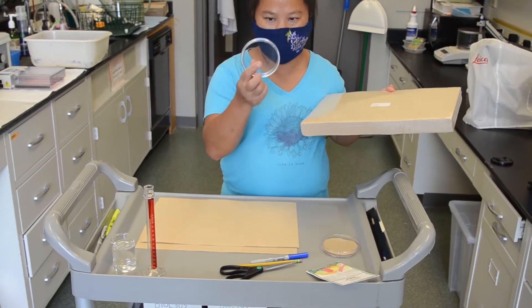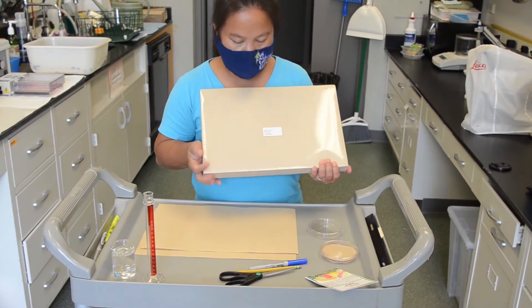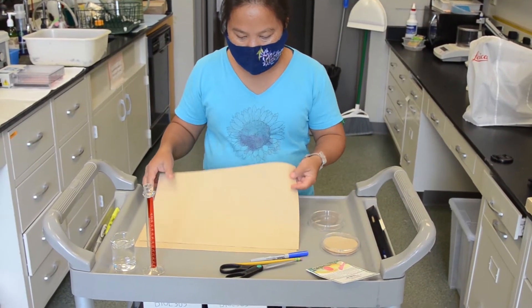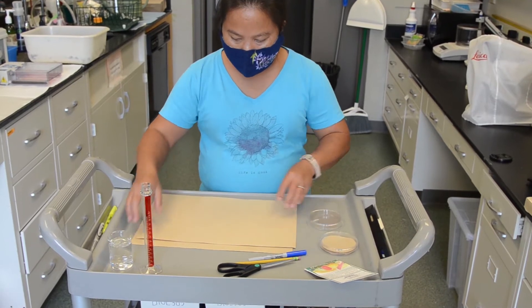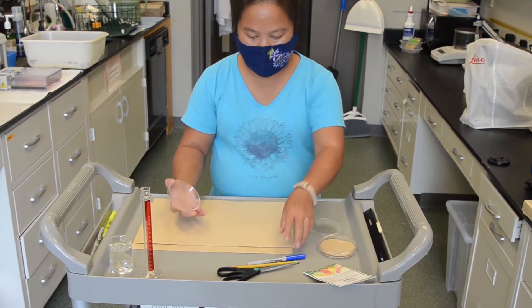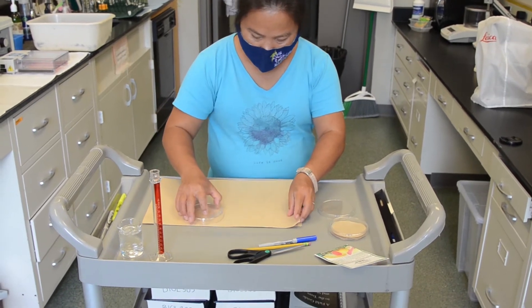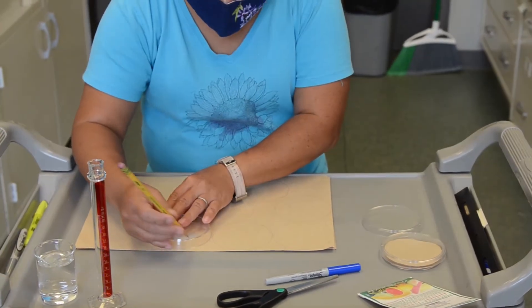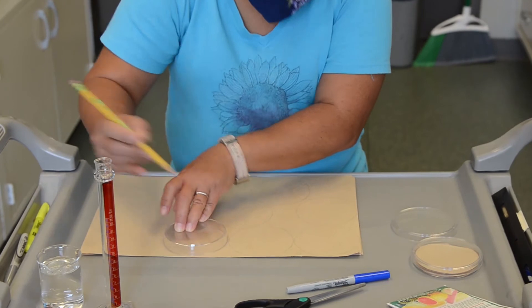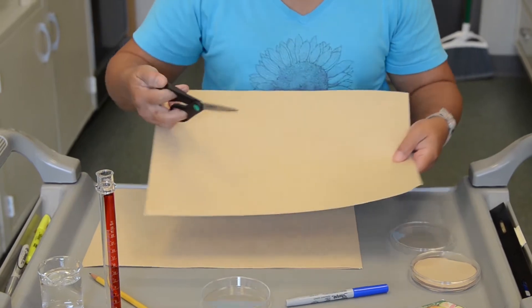You will get a clean petri dish and then pick up the seed germination paper which comes in the form of brown color. You don't need to use much, just one piece of that paper, and after that you use the bottom part of the petri dish. Put it on the paper and make it, draw like a circle. As best you can, and then use the scissors and cut it around.